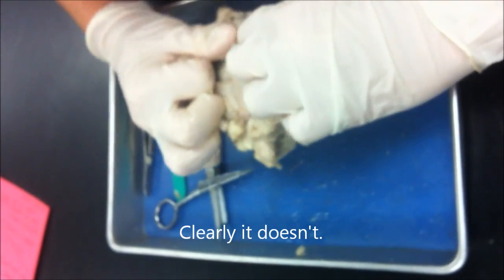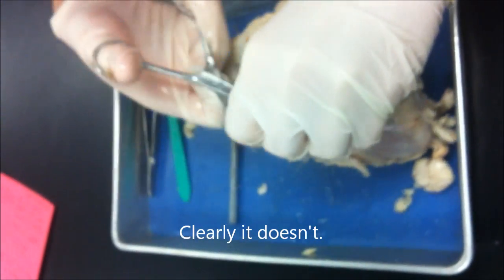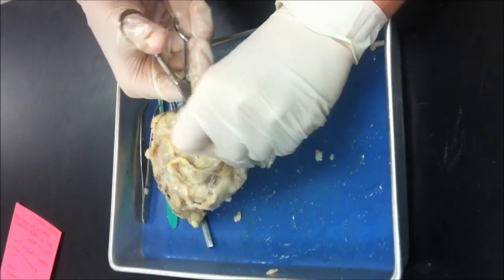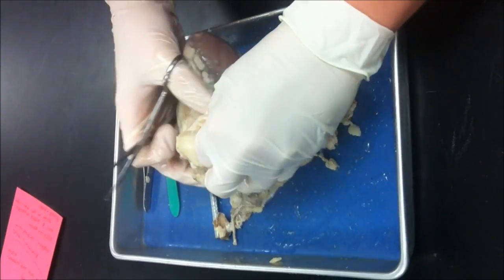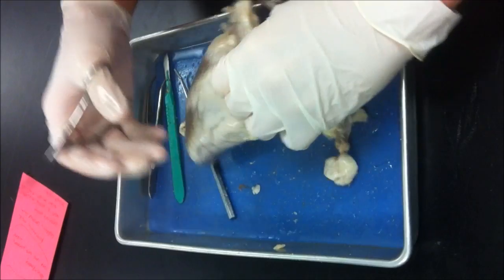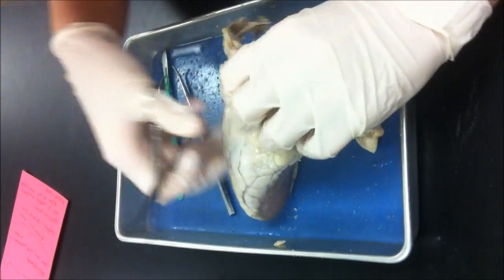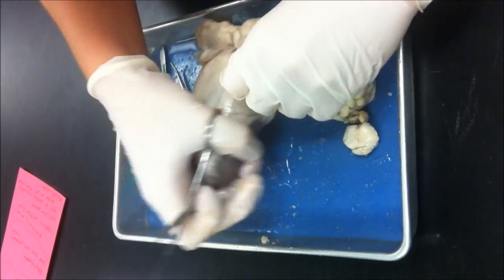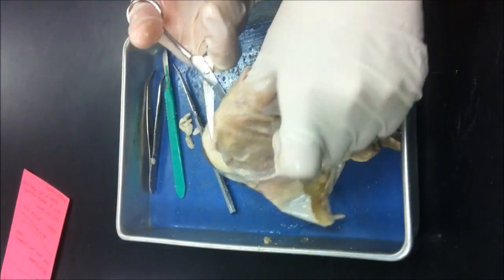You can just pull it or cut it. If it's too tough to pull, keep cutting. So if you just cut this off, make sure you don't get the heart. If you can get it to this point, all you have to do is cut around the heart and detach some. If I can move it, it's so slimy.